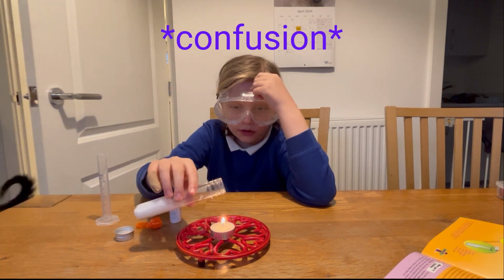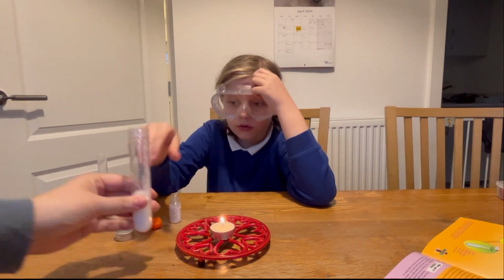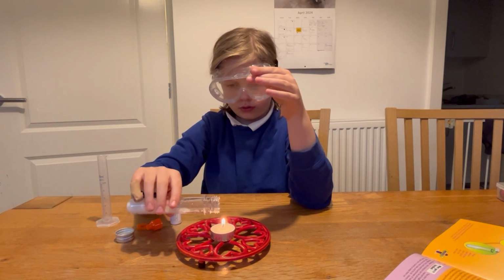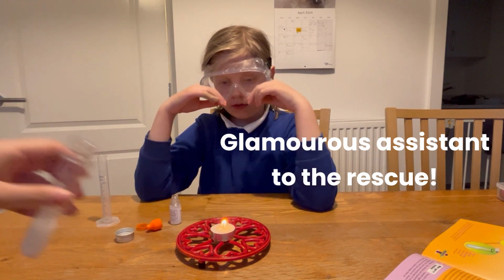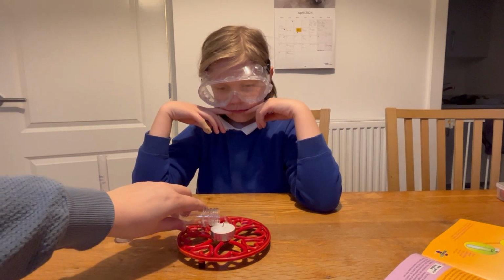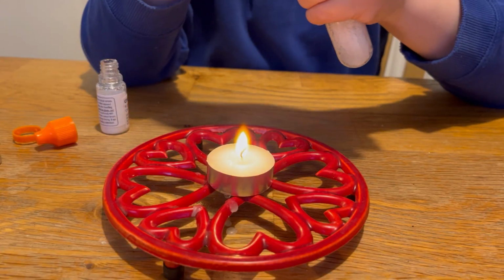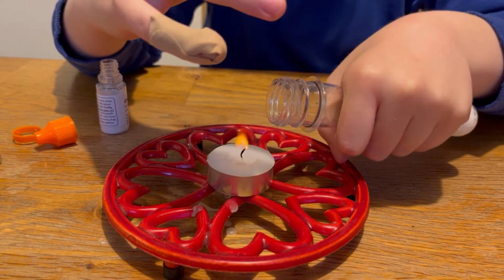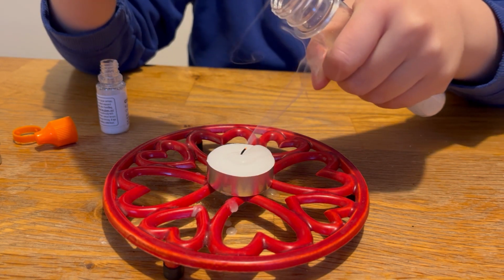It's not working. Why is it not working? Ta-da! We are going to do this again in slow-mo. So, oh, it worked, but I tipped it in at the last second.